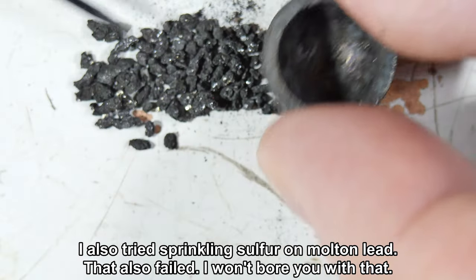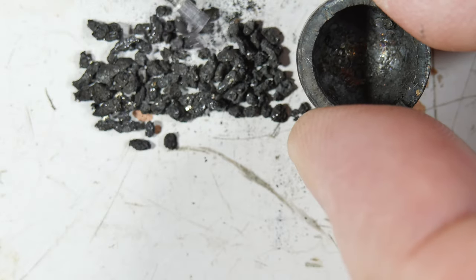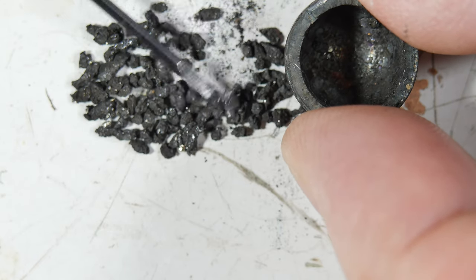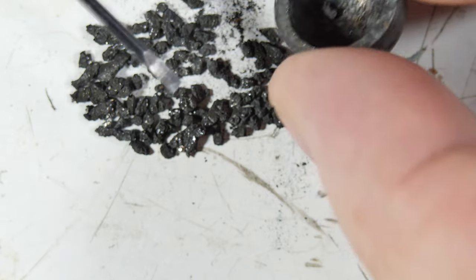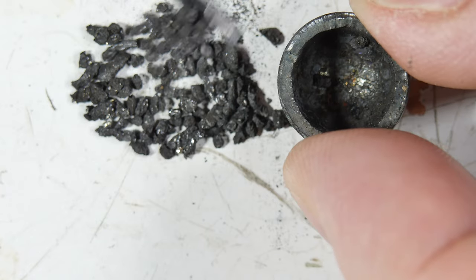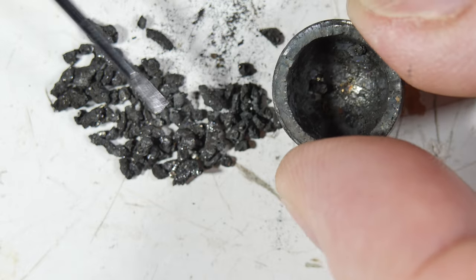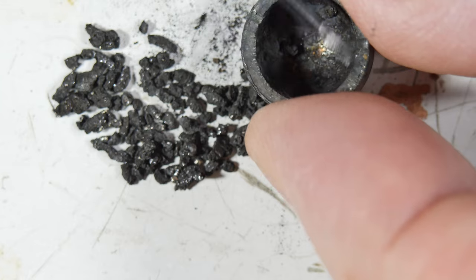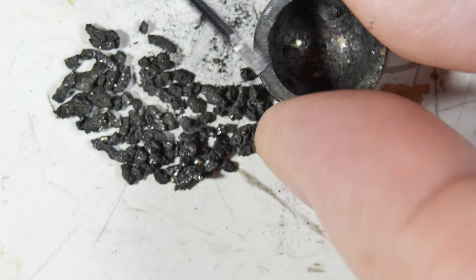I think there's two things wrong. One of them is the temperature wasn't high enough long enough, and the other thing is that the lead was not fine enough, and it should have been mixed more thoroughly with the sulfur, and then in a vessel that was more airtight. You should never cook something in something that's completely airtight, like a screw-on lid, because then you've got a bomb. But just a lid that would sit on here and not let oxygen come in contact with it. The washer wasn't good enough.